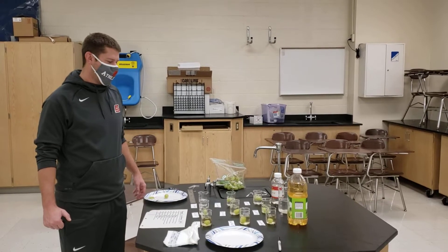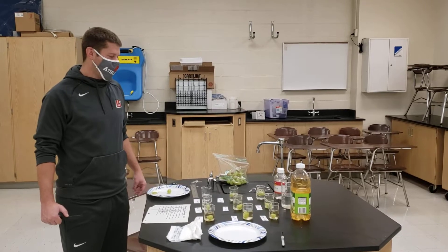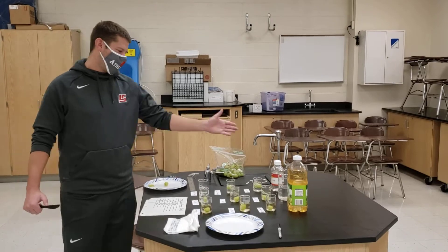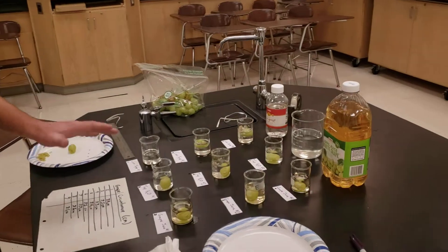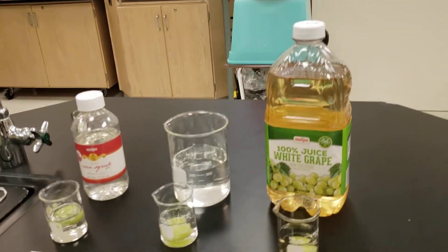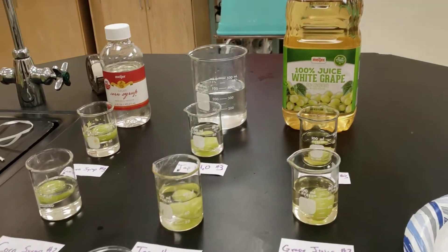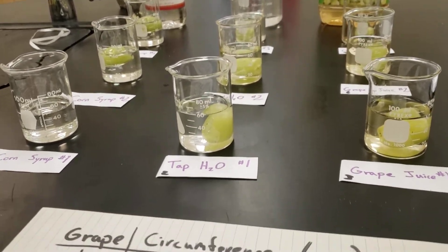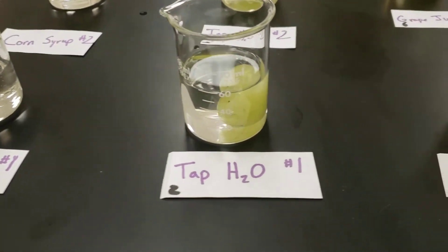Biology students, this is the pre-lab section for this week. We have three different liquids: corn syrup, tap water, and grape juice. We poured 50 milliliters into each beaker to keep them all the same. There are already some grapes in there. We have three different liquids across three different trials because in an experiment we do three trials to make sure the data is good.